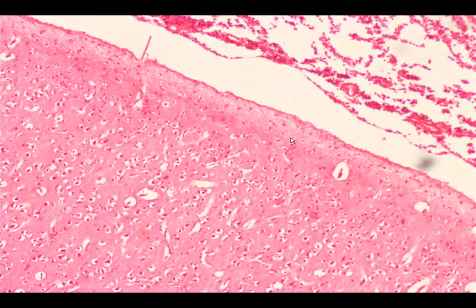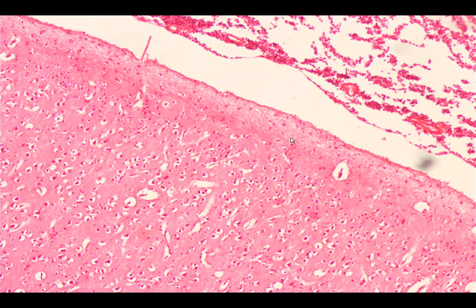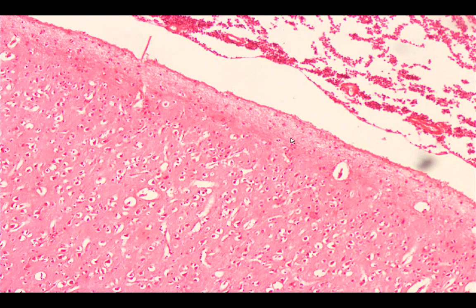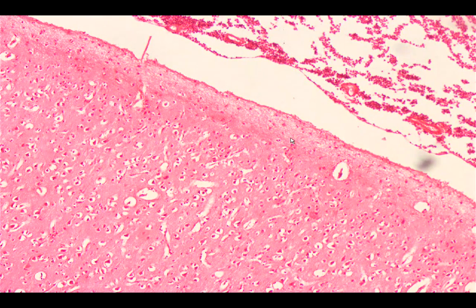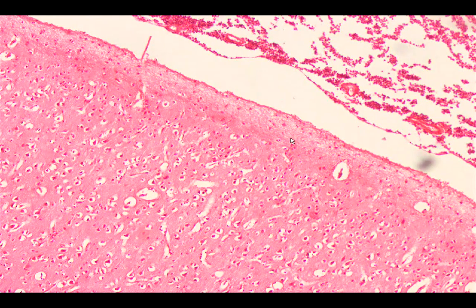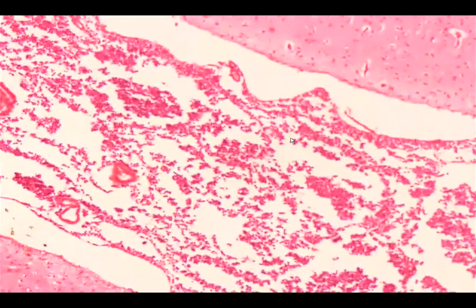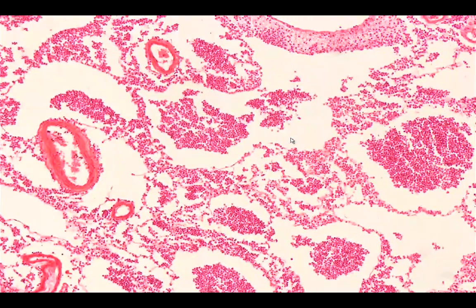Sometimes patients may exhibit signs and symptoms of septicemia, and we call it meningococcemia. This is what we call the Waterhouse-Friderichsen syndrome — F-R-I-D-E-R-I-C-H-S-E-N — attributed to meningococcal or pneumococcal meningitis. That's acute meningitis; you can see a lot of those inflammatory cells.